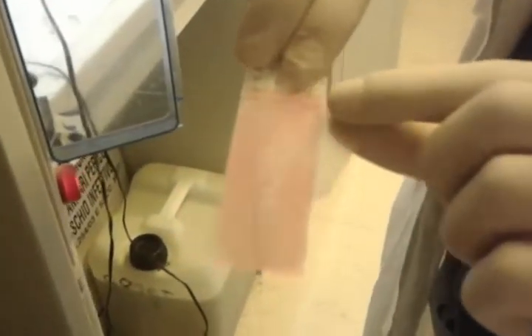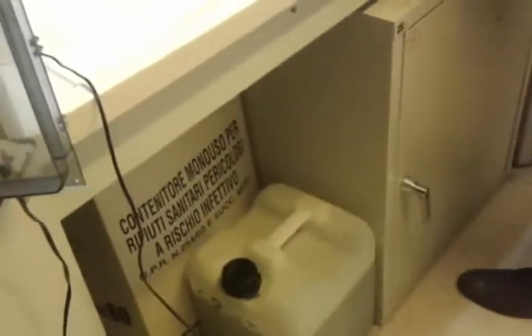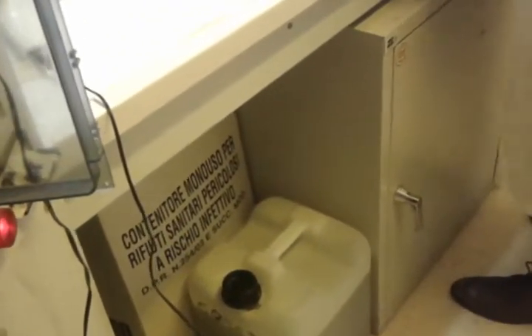How to remove the covers now? So you put two slides back to back and remove? Yeah, because I was wondering where did the two cover slips come from. So two slides back to back and then? No, two slides, two slides. Okay.